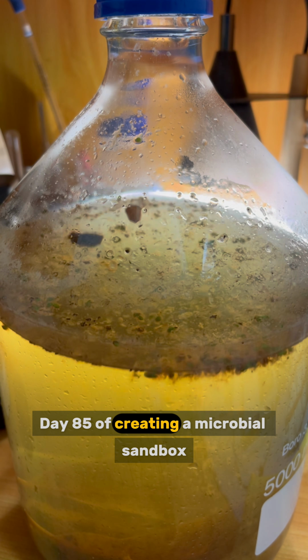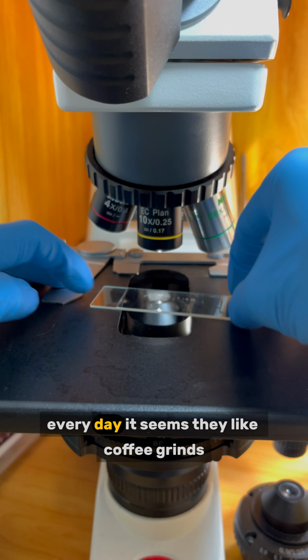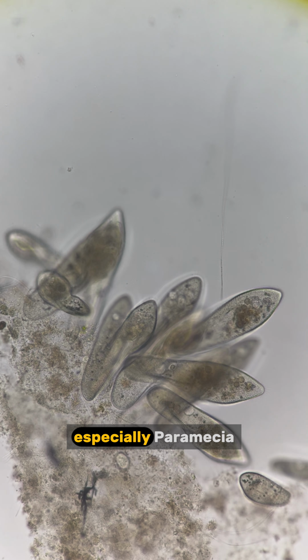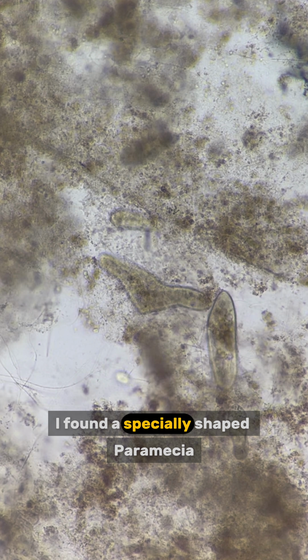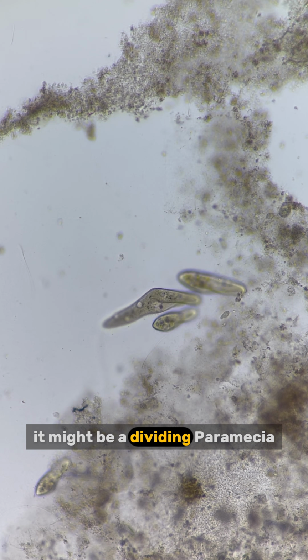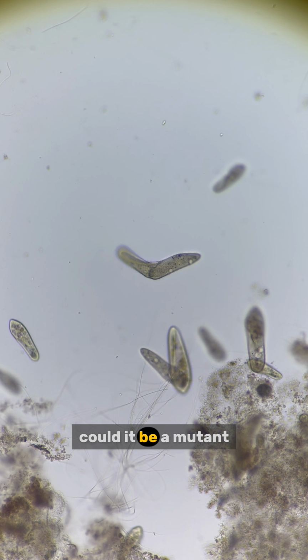Day 85 of creating a microbial sandbox by adding random stuff and observing it under the microscope every day. It seems they like coffee grinds. They concentrate around the grinds, especially paramecium. I found a specially shaped paramecium. It looks like a boomerang. It might be a dividing paramecium, but it actually looks a bit different from the ones I have seen before. Could it be a mutant?